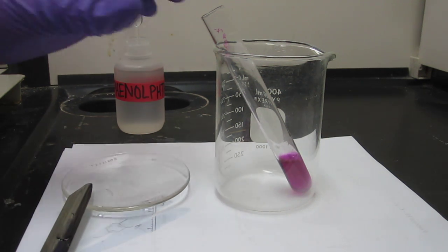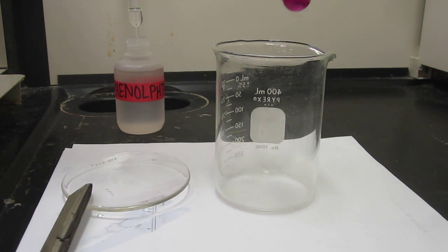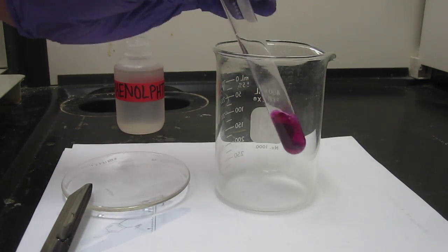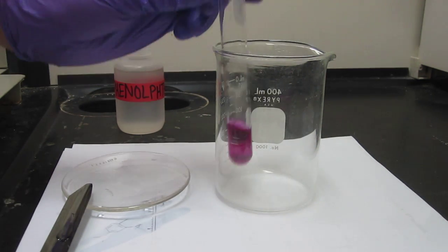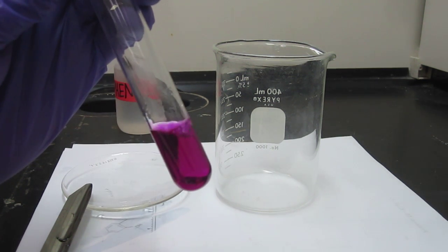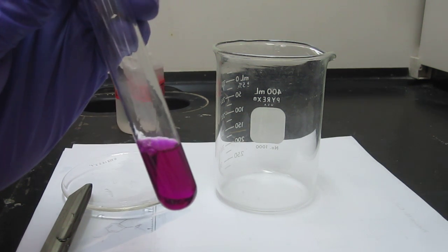So you can see how slowly the sodium is reacting relative to how fast it reacted when we had the water. Does it have to be a darker bulb? Yeah, definitely. So what is the gas that's being formed here? Hydrogen. Hydrogen gas.